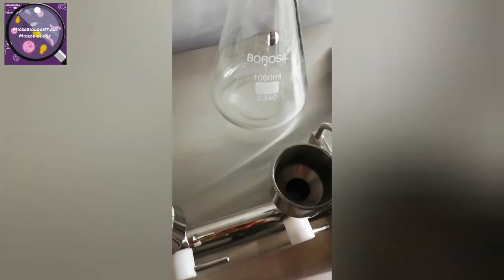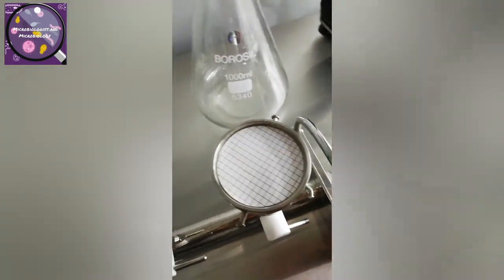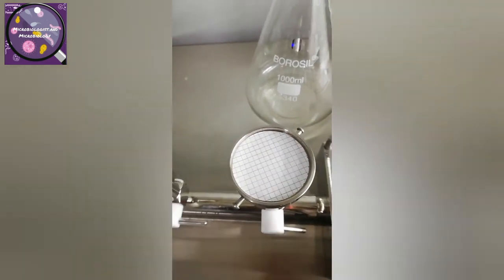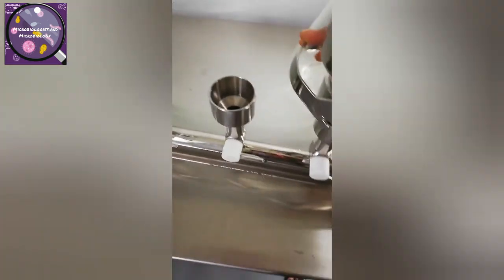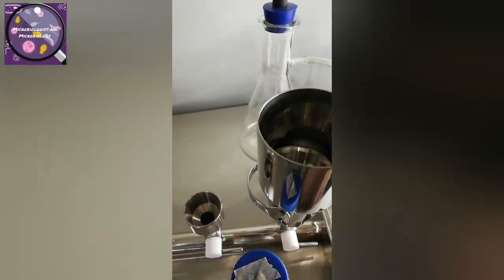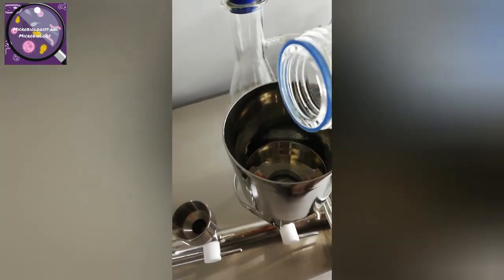This important information related to filtration assembly has been covered so far. I am now sharing the standard operating procedures for filtration assembly and the technique. Before sharing the SOP, I would like you to know that the clips in this video are from my microbiology lab.